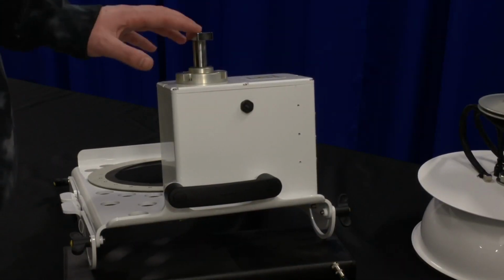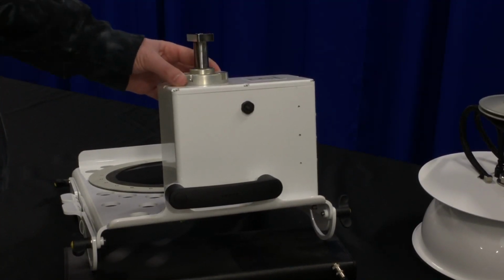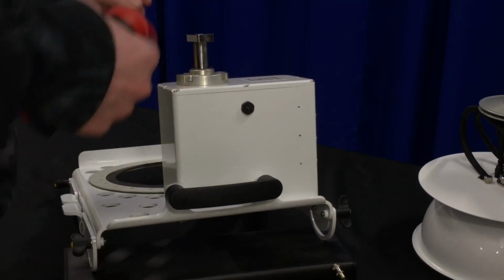Okay, now that the arm's out of the way, all we need to do is take off the column adapter, and then we can remove the old shaft seal assembly.